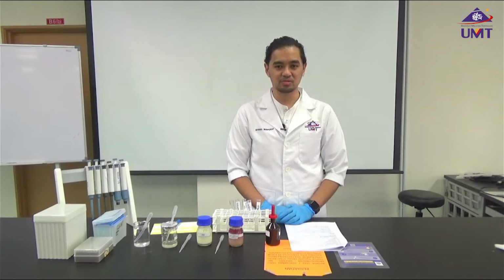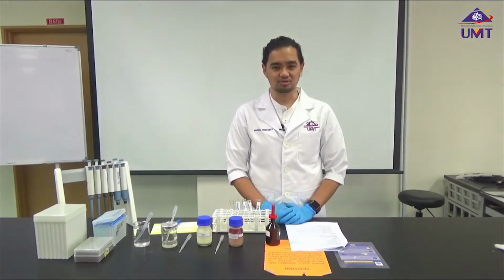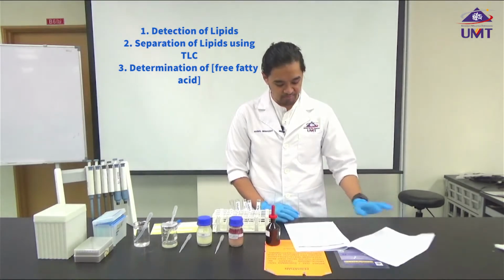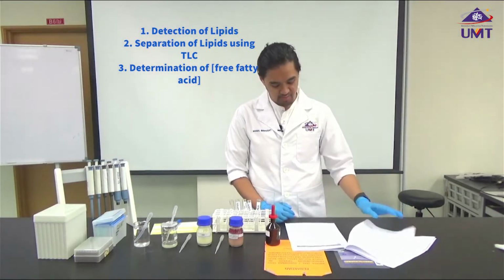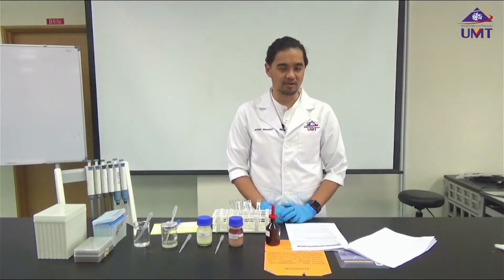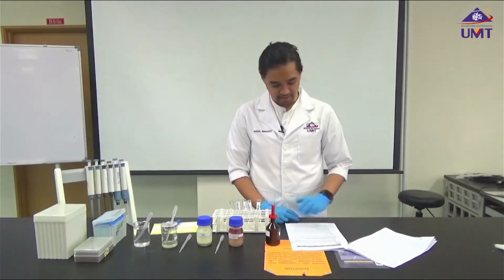We're going to do detection of lipids, which is one of the macromolecules that has been introduced for you during the class session. In this particular session, we're going to do three types of experiments on lipids. The first one is the detection of lipid, the second experiment is the separation of lipid using TLC, thin layer chromatography, and the third experiment is to determine the free fatty acid concentration. Those are the three experiments that I'm going to introduce for this session.